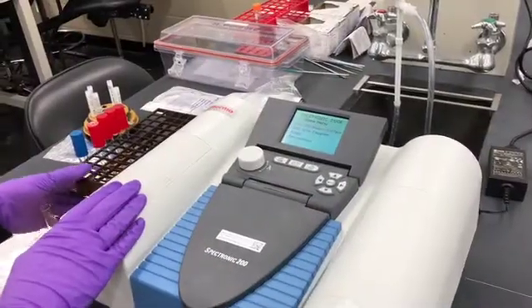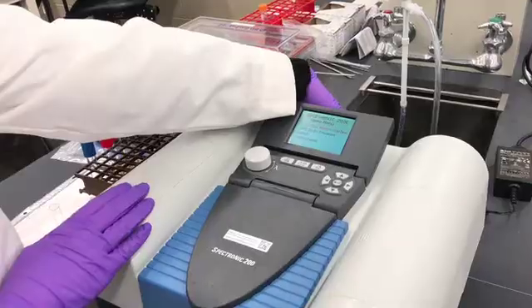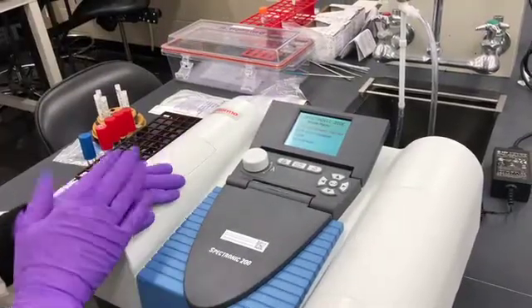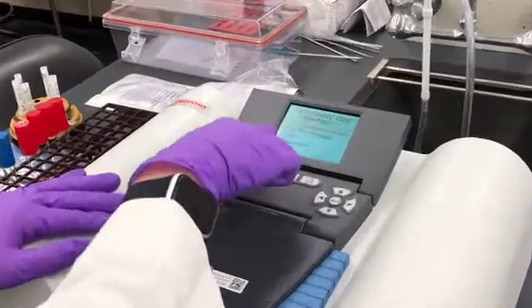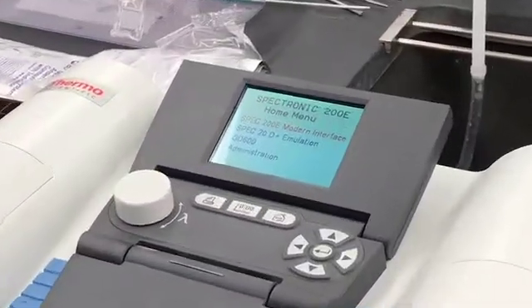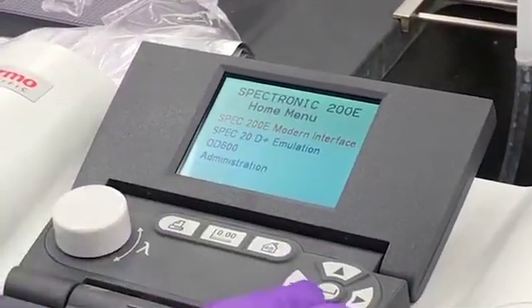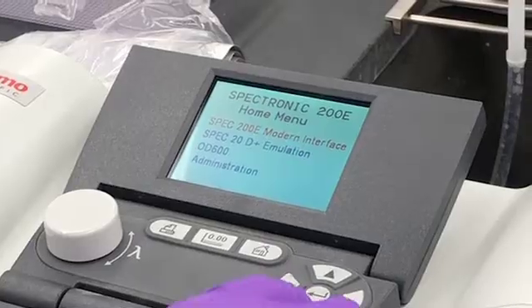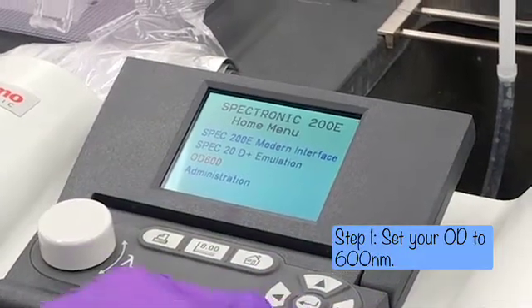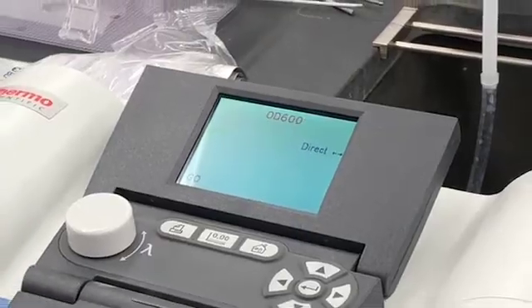Now we're at the spectrophotometer. The only thing I've done is turned it on with the back toggle switch. We're going to be doing a reading at 600 nanometers, so we're going to go down using the down switch to OD600 and hit enter, and it's going to send us to the screen.